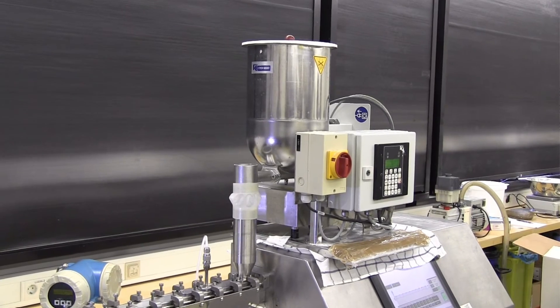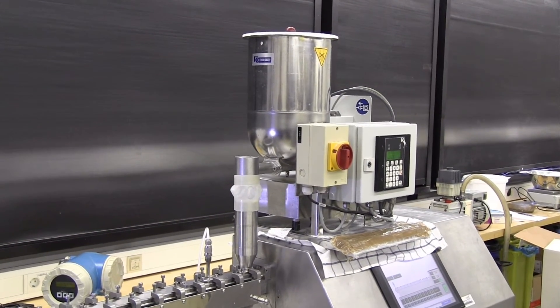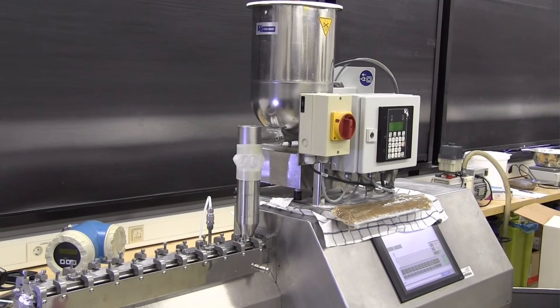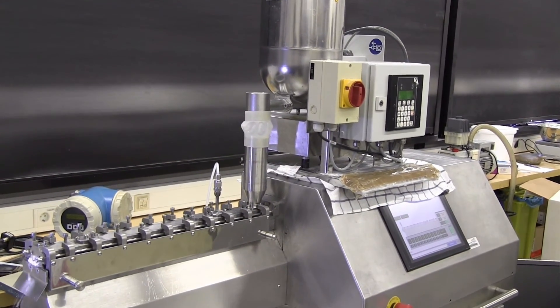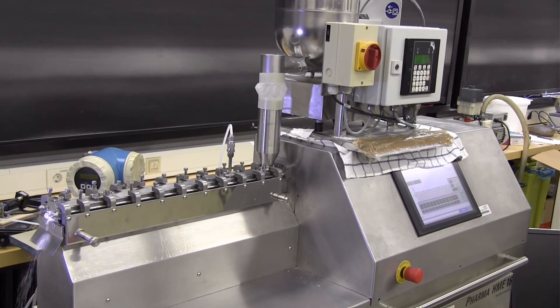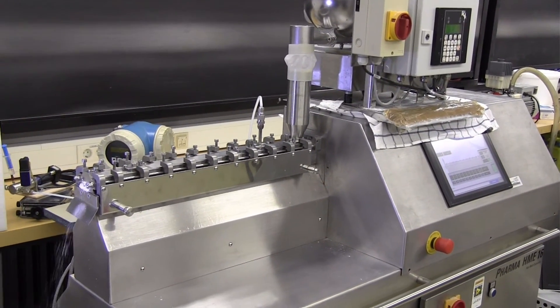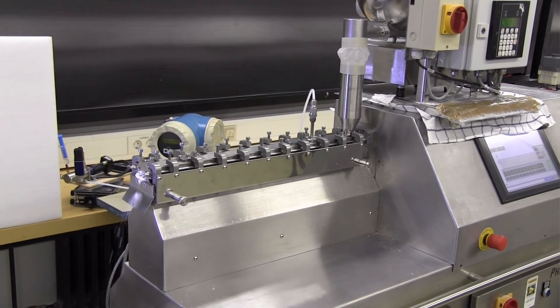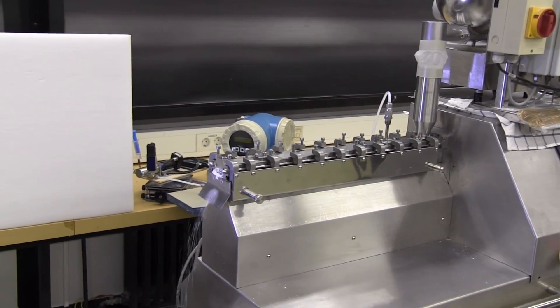Continuous twin screw granulation is a process by which a granulate is produced from a powder in conjunction with a liquid or liquefied binder. This process is used in several industries such as the pharmaceutical industry and the food industry.